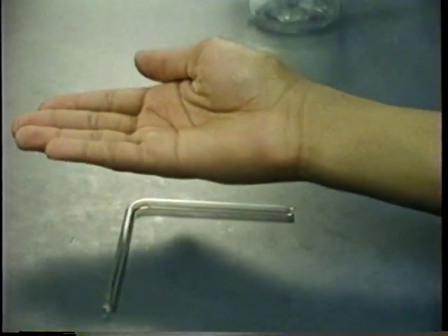How do you know when it's cool? Well, you can't tell by looking at it. A good way to tell is to bring the back of the hand down just above it.